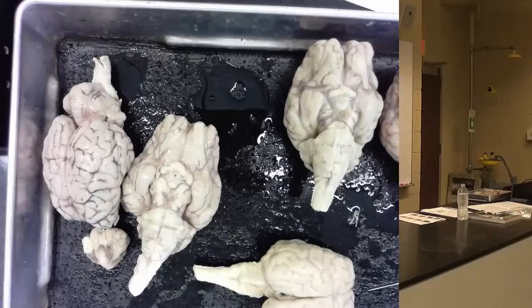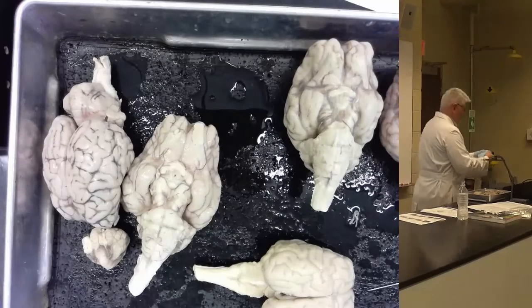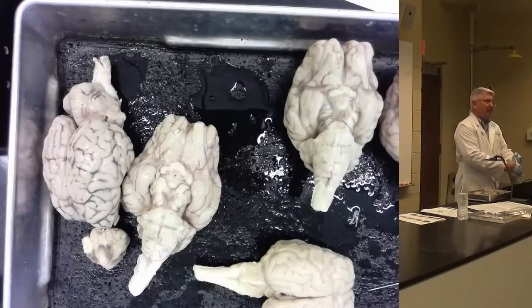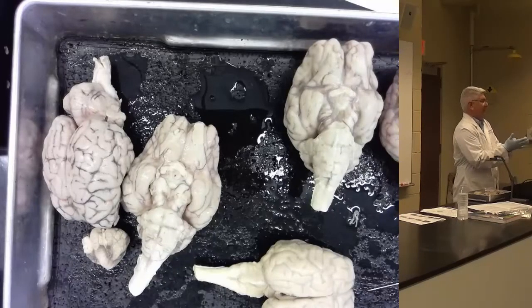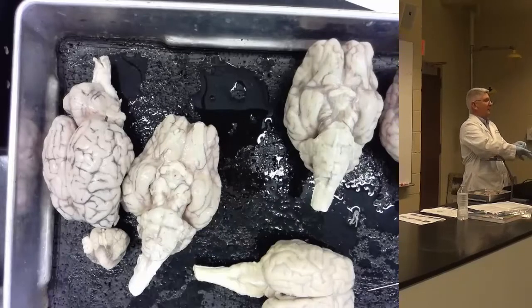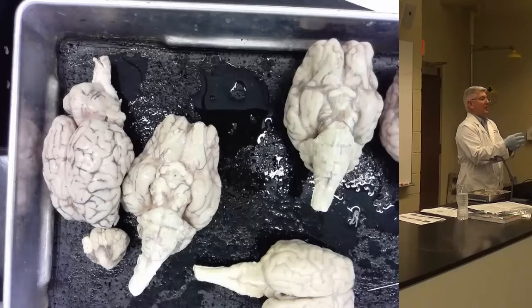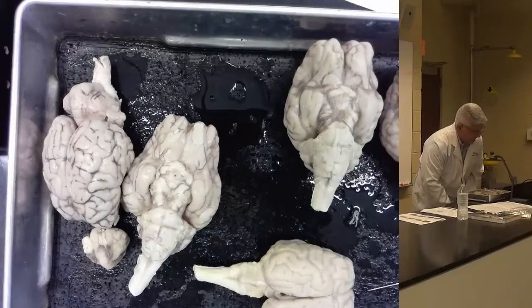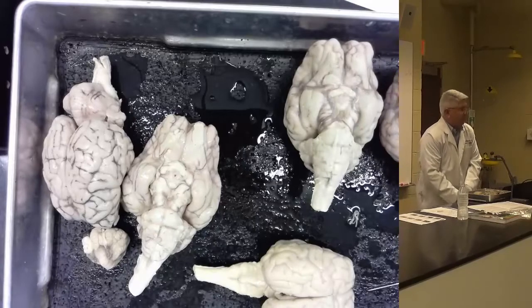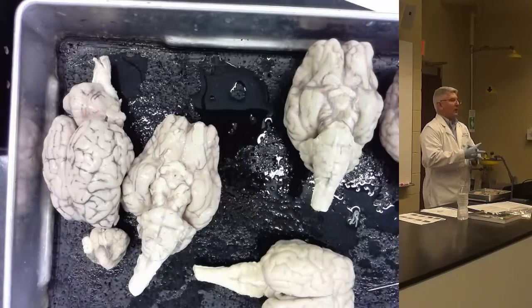It does do hearing. And you also said it stores memory. Stores memory. So you think sheep have very good memory? Very tiny temporal lobes, right? Humans have very big temporal lobes. Probably don't have the same memory capacity as us. So we don't need to know the pre-central and post-central on the sheep? No. But you do need to know that on here. And I do have a section that is 16, specific human gyri. That's only going to be on human brains.